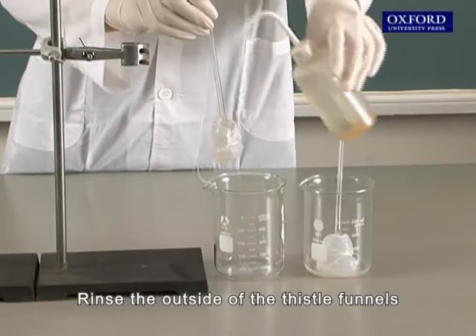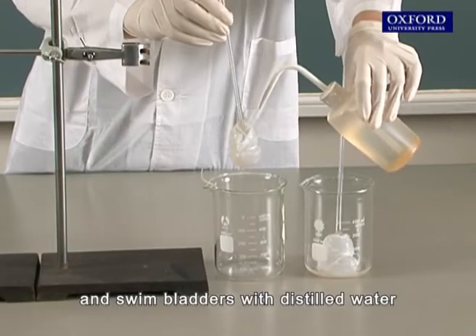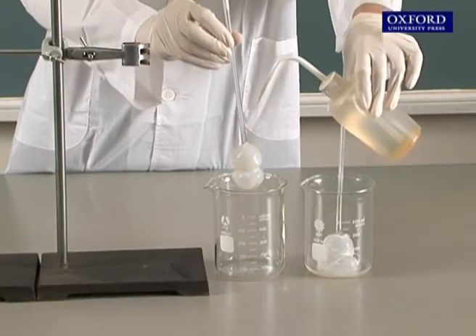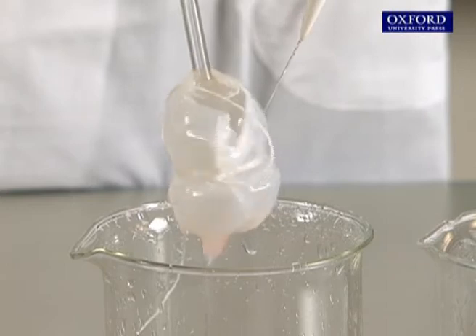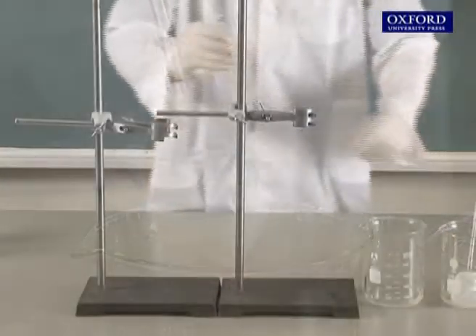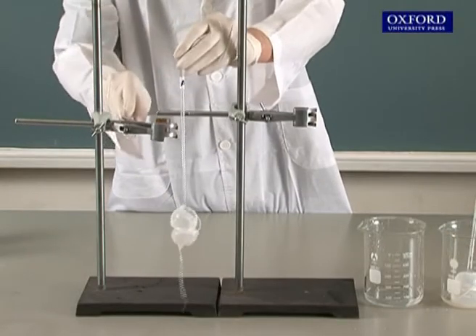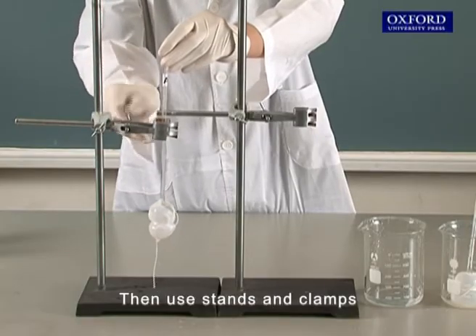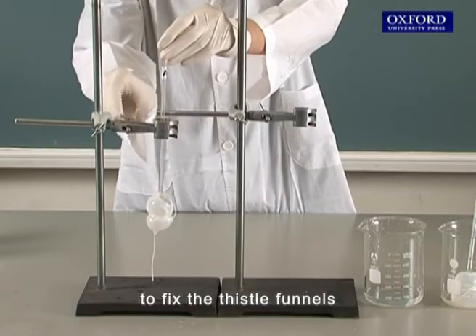Rinse the outside of the thistle funnels and swim bladders with distilled water. Then use stands and clamps to fix the thistle funnels.